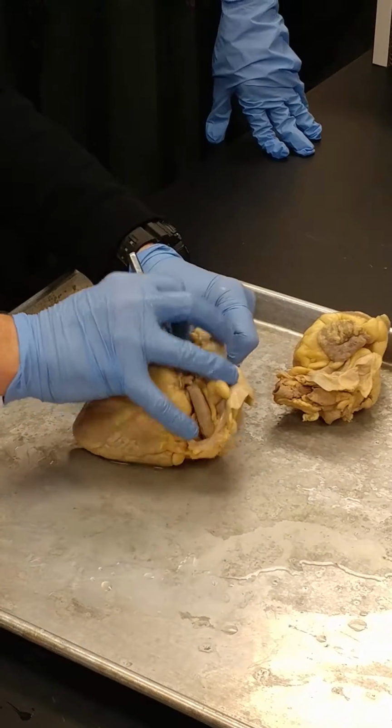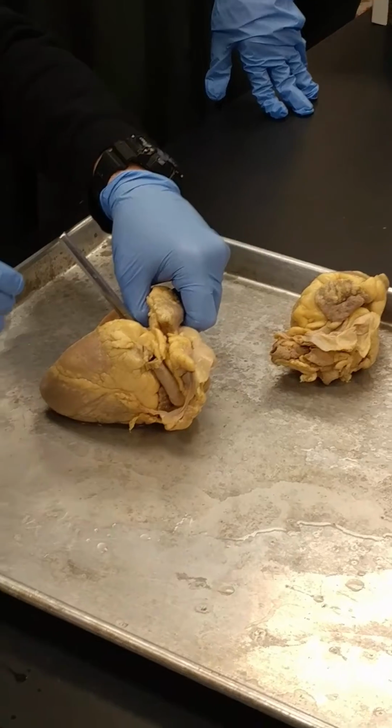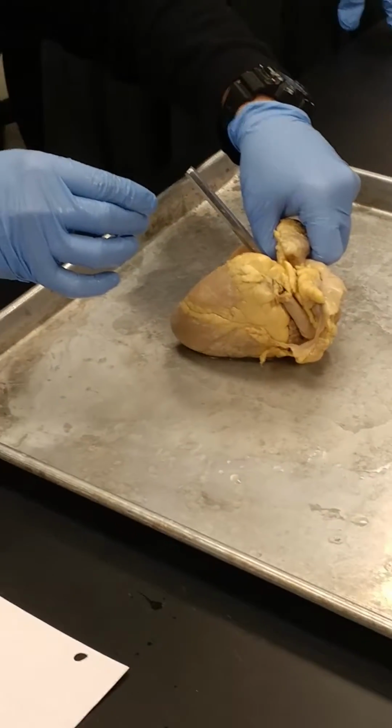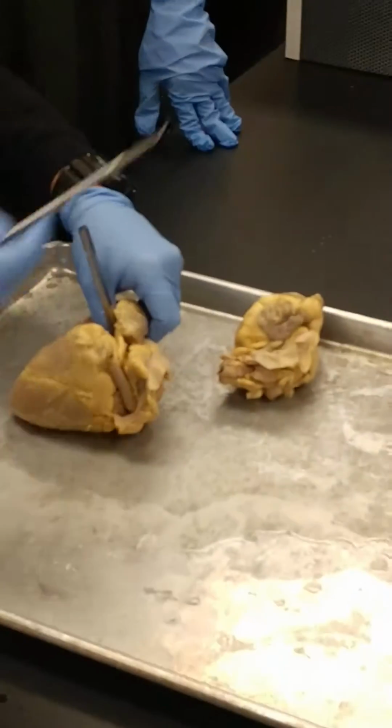So now, if you look in there, grab me another probe, please. Yeah. Back there. Thanks, John. Thank you, sir. All right.